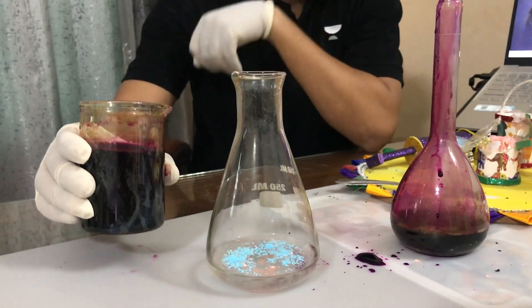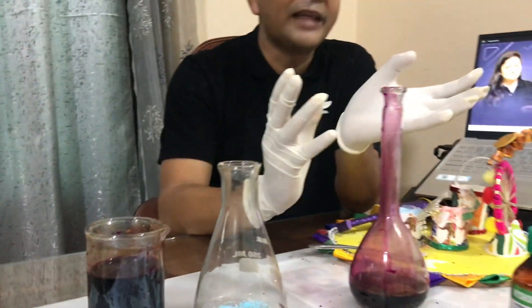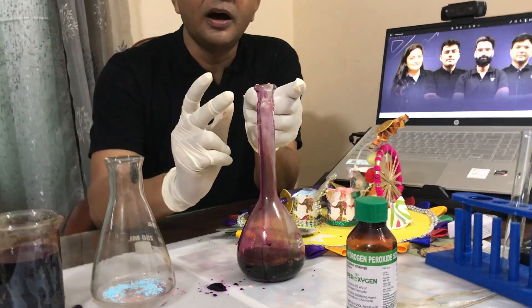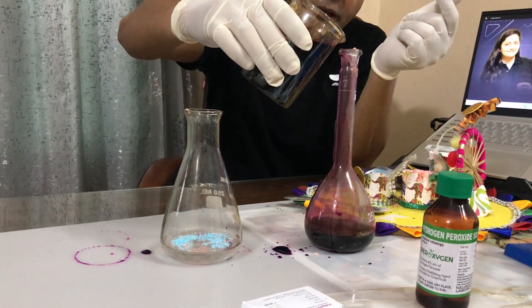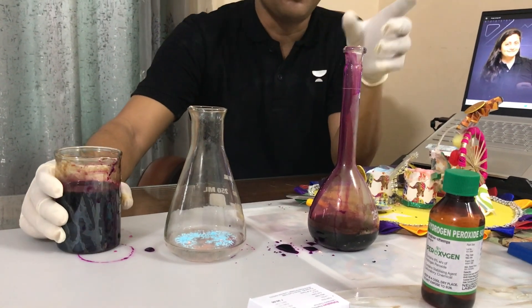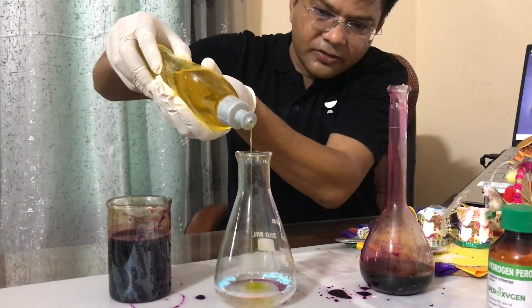Now the same thing I'm going to do in this conical flask. Let me add KMnO4 to this and let me add some dish wash. The reaction is not that big — we cannot see the foam coming out because oxygen got released. Let me bring some dish wash. Once again I'm adding some KMnO4 to it, and as the oxygen gas is going to get released, if I add some dish wash now — see kids, you can see better the oxygen coming out.